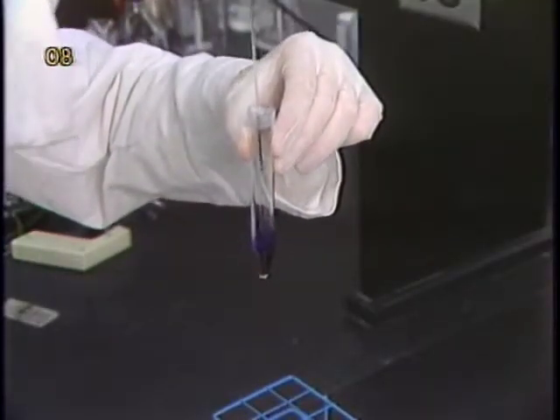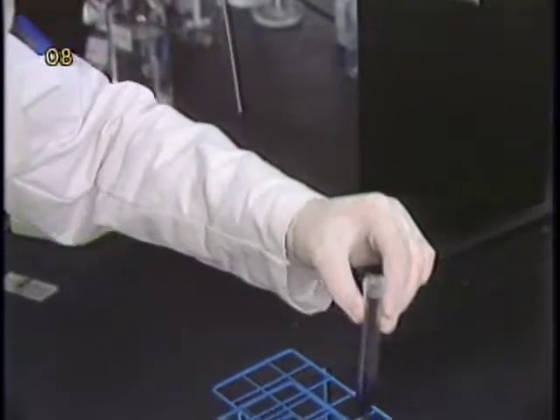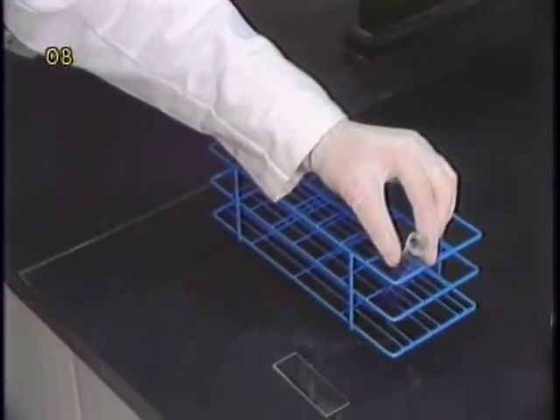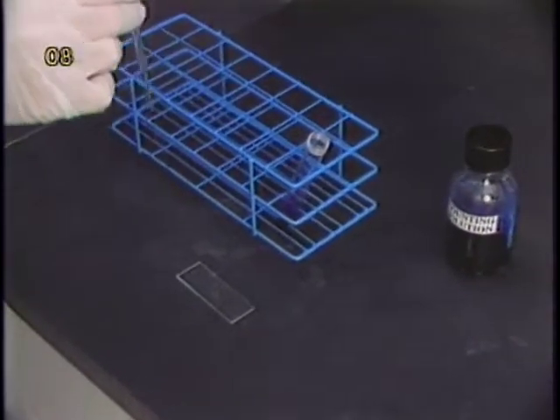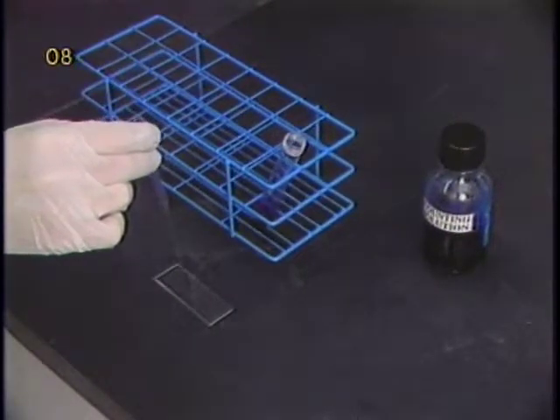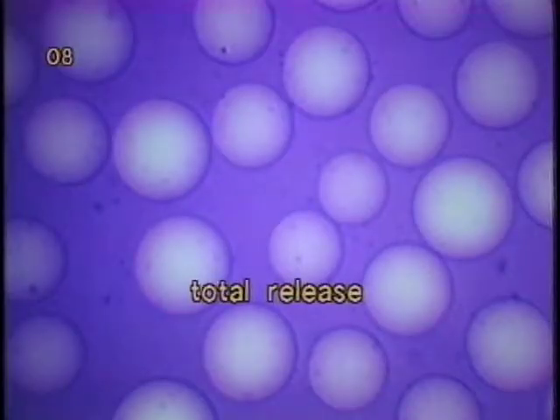After this shearing step, it is advisable to place a drop of this nuclei microcarrier mixture on a glass slide to observe under a microscope. This can help in ensuring that all nuclei have been released from the microcarriers and helps improve the counting accuracy.